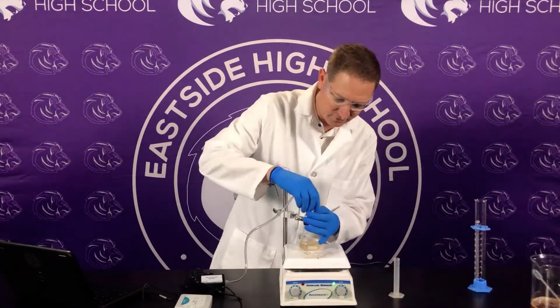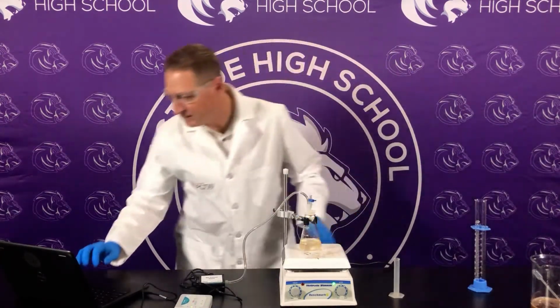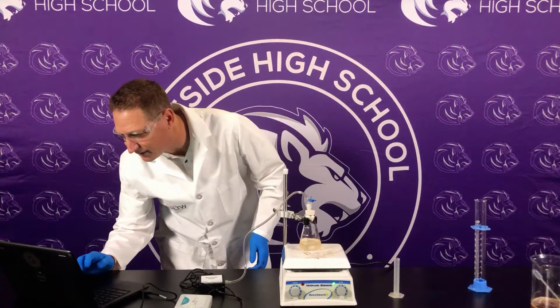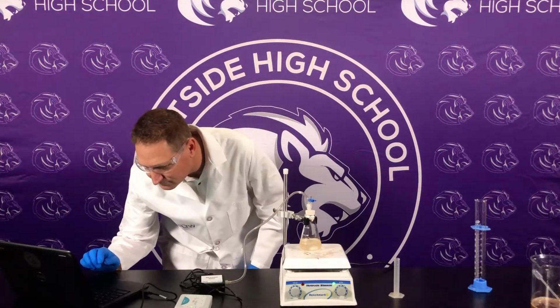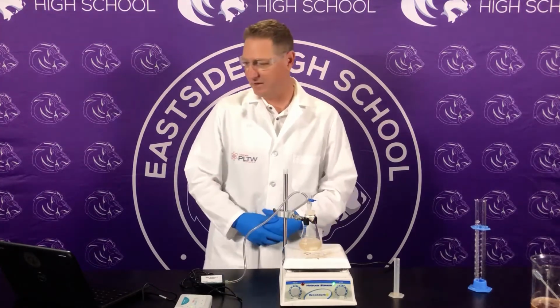Make sure this is secure. Everything's ready, and collect. Make sure that it's going. 200 seconds, we'll be ready to go.